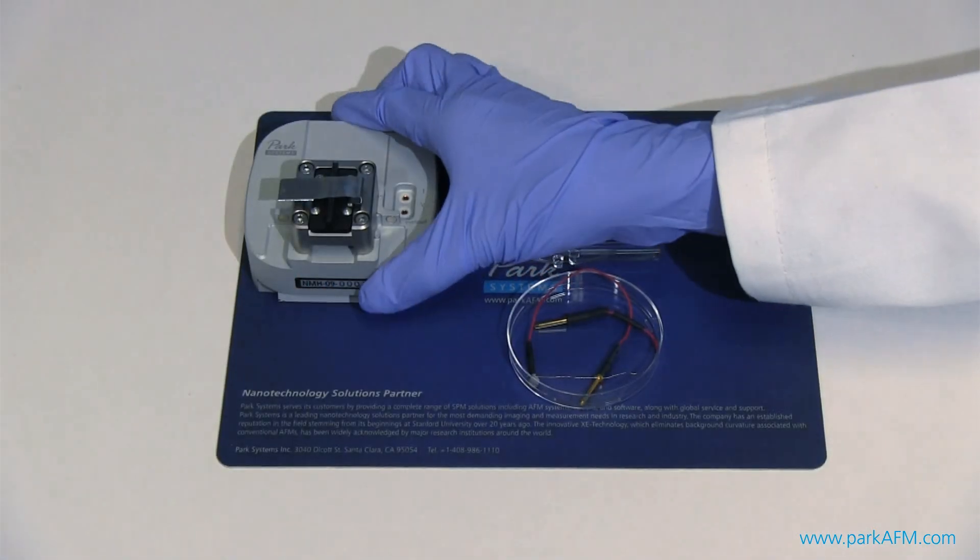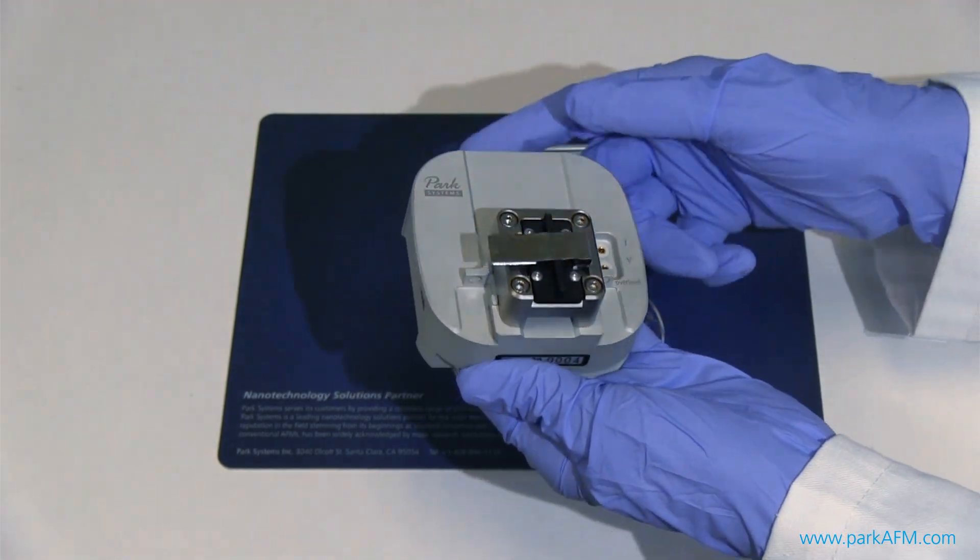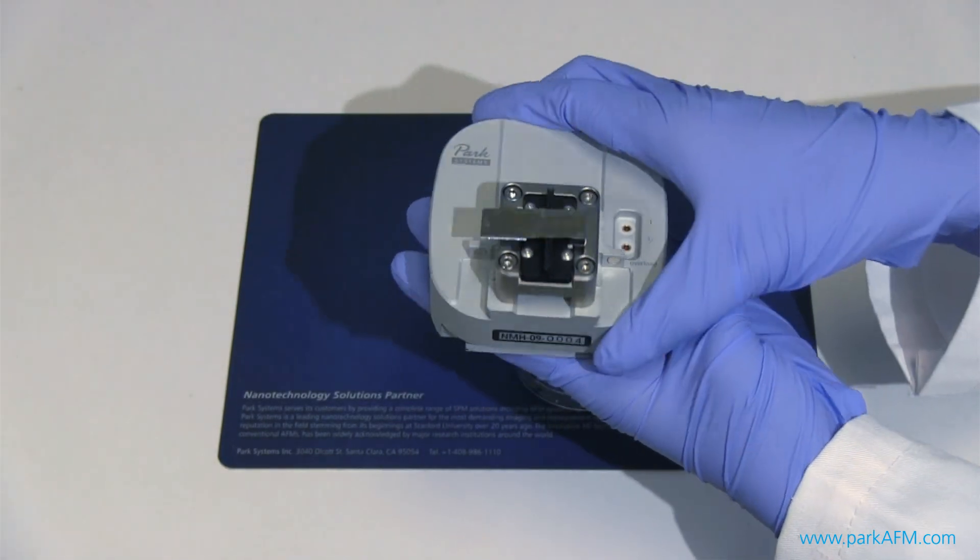Here is the SICM head used for NX10 system. The two holes are used to plug in the two electrodes and the pipette head is held using a spring clip.